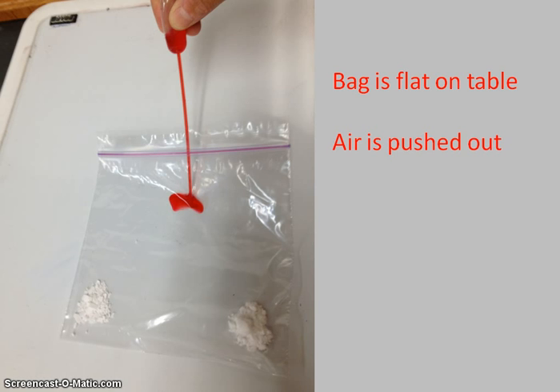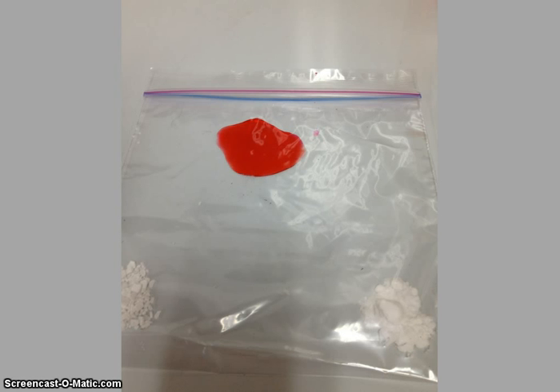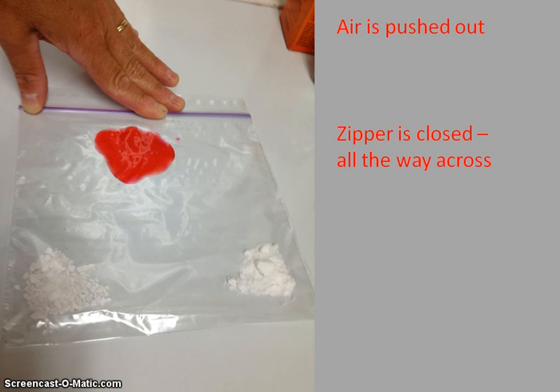This is what the Ziploc baggie should look like after you've put the two solids into the corners of the bag, and as you are putting the phenol red into the Ziploc bag as it is laying flat on the table. You'll want to make sure you push all the air out, and then make sure that you seal that Ziploc completely.